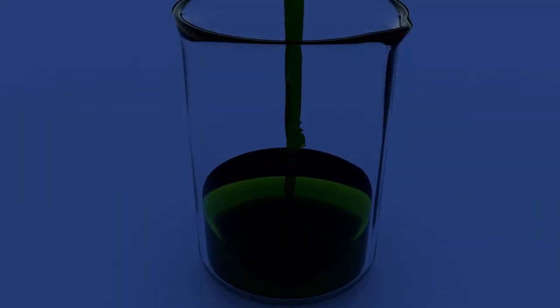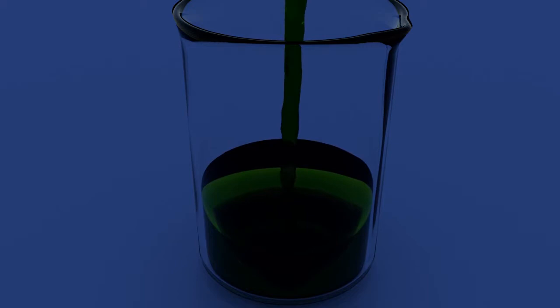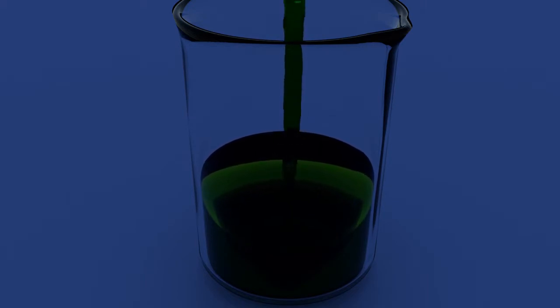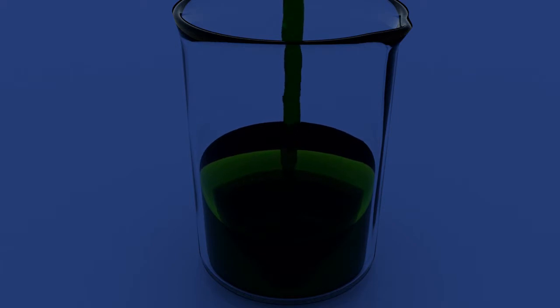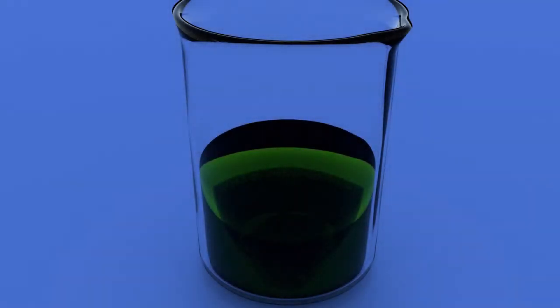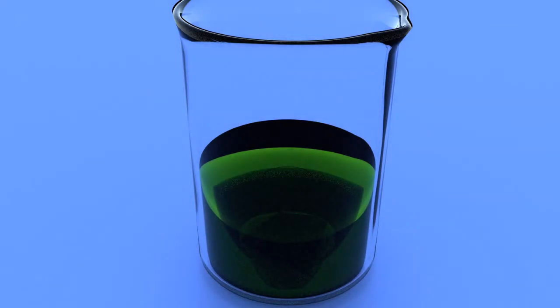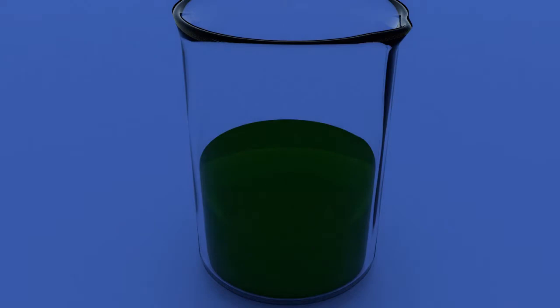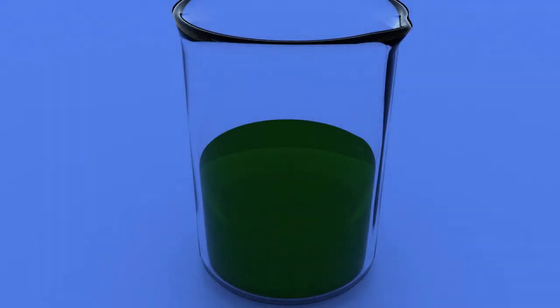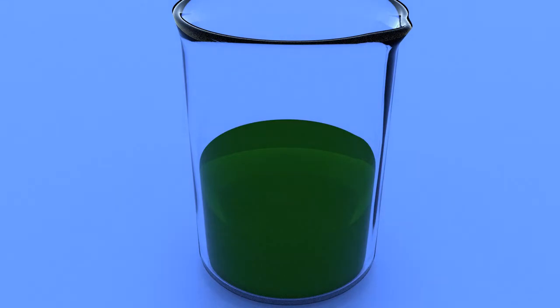After filtering or decanting, the solution should be clear of all solids including particles. The solution may be very very dark and that's fine, however it should not be even a little cloudy or murky. If you see any cloudiness or murkiness it means that there are particles floating in solution and you should filter or decant again.